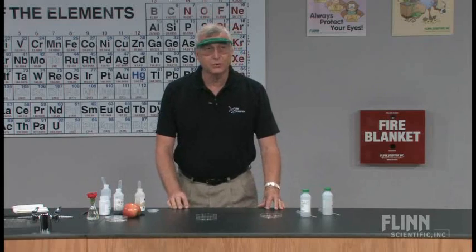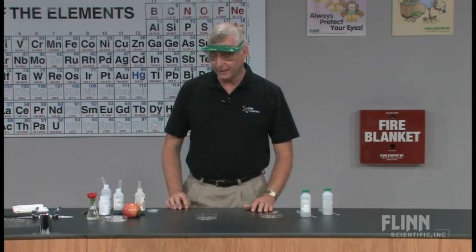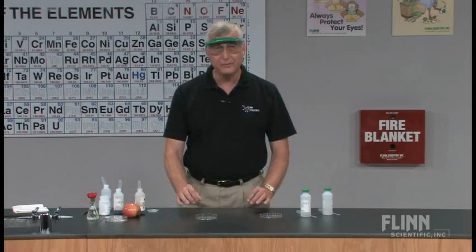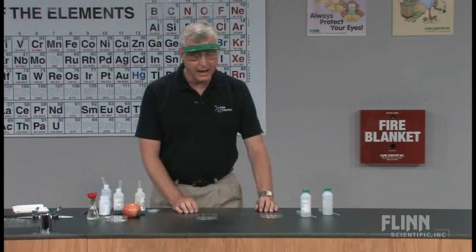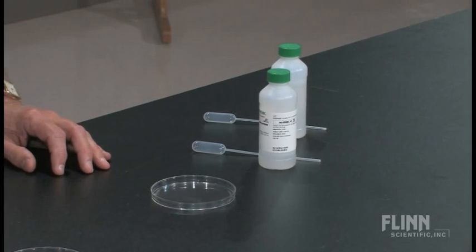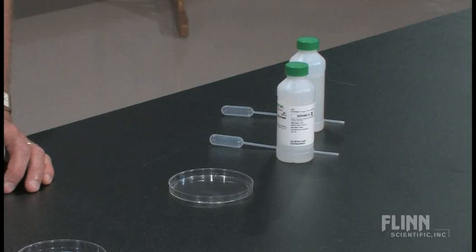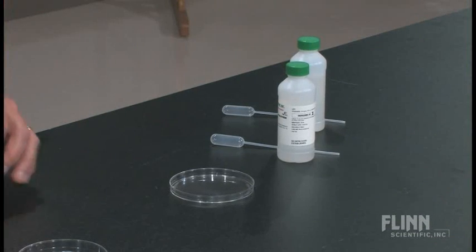So what we're going to do is we're just going to set the experiment up and we're going to see what happens. I have a Petri dish, and into the Petri dish we're going to place a variety of samples of materials to simulate materials that we might have in the environment.